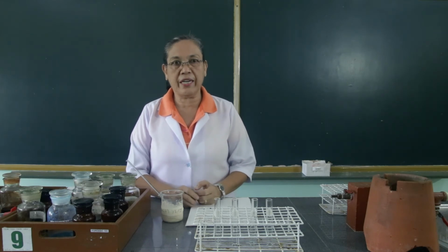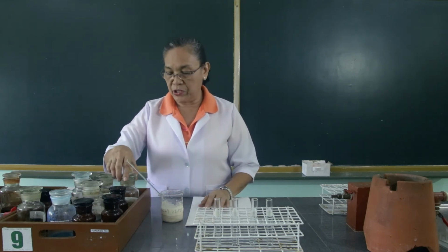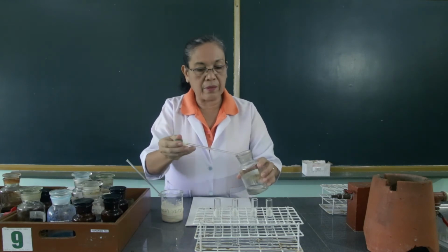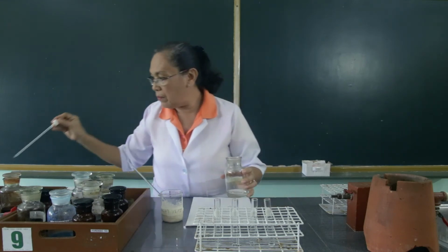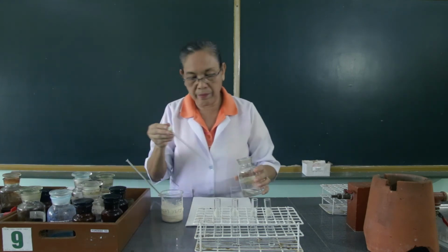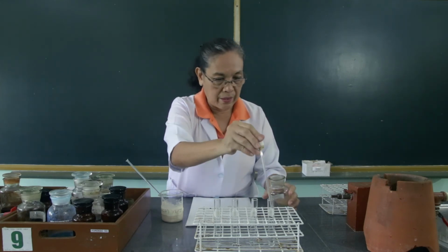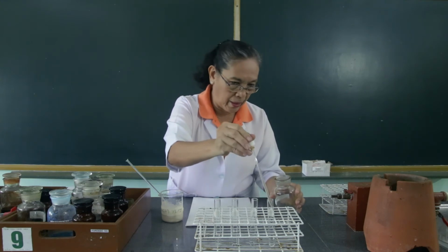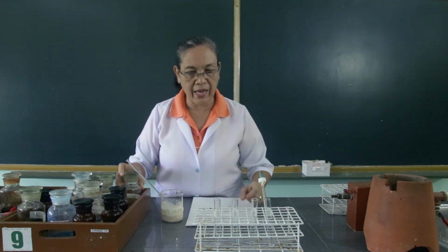The next reaction that we're going to exhibit for the carbohydrates is the fermentation test. Now, we're going to fill these 4 test tubes with the carbohydrates, which are glucose, then to the second test tube, we will fill this with galactose.